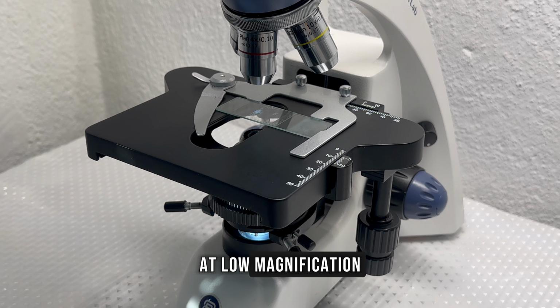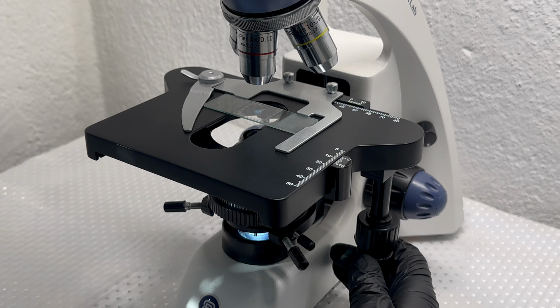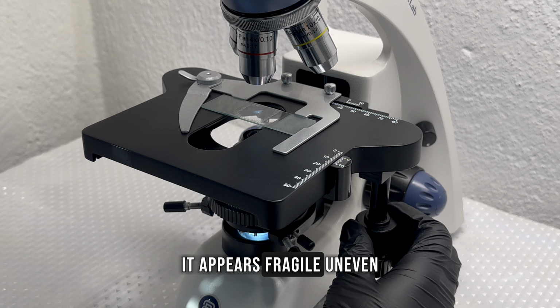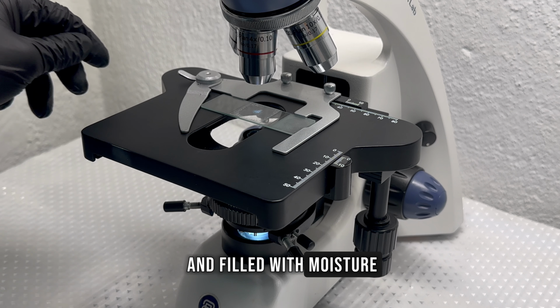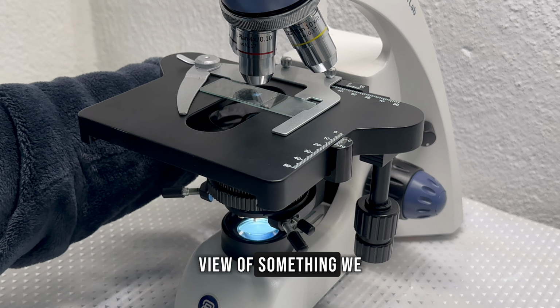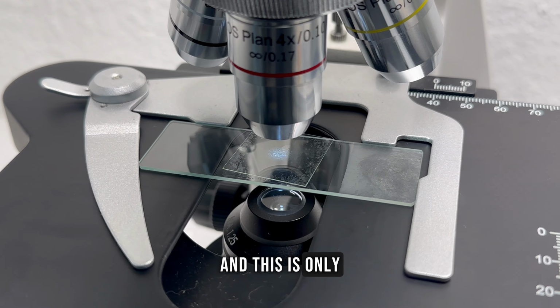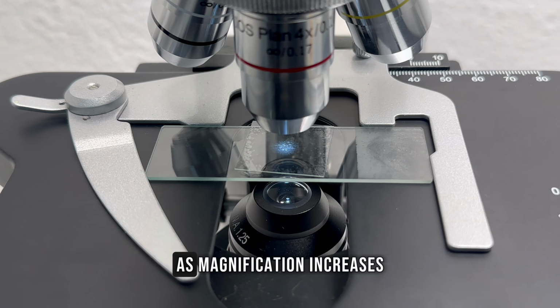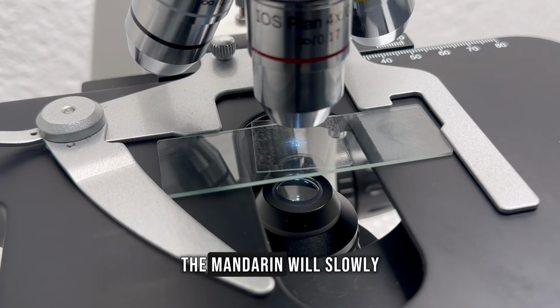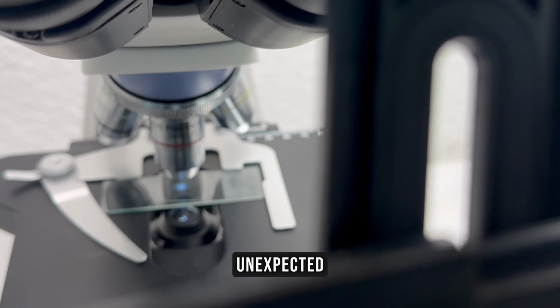At low magnification, the sample already looks very different from a slice of fruit. It appears fragile, uneven, and filled with moisture. This is the first step into a microscopic view of something we eat almost every day. And this is only the beginning. As magnification increases, the mandarin will slowly transform into something completely unexpected.